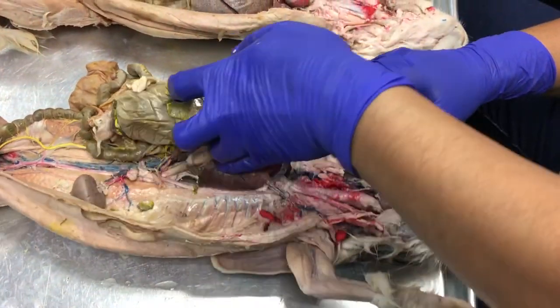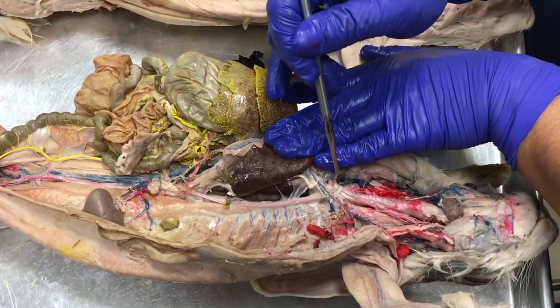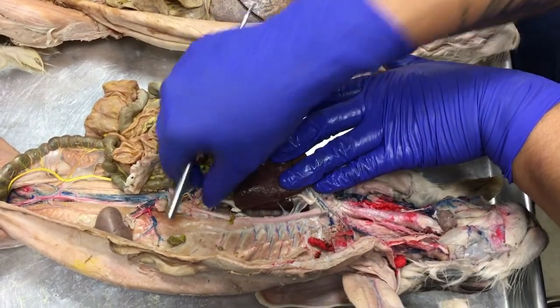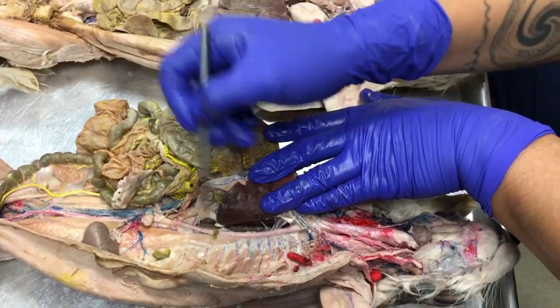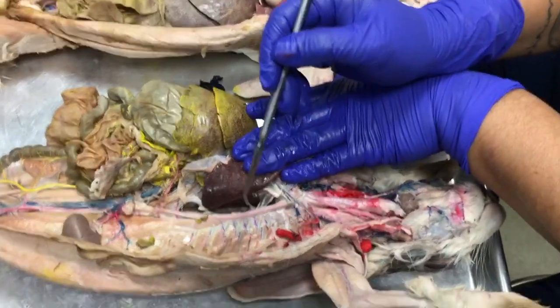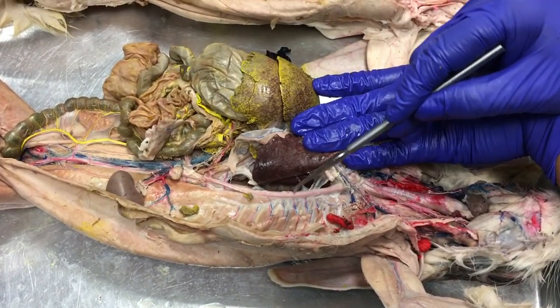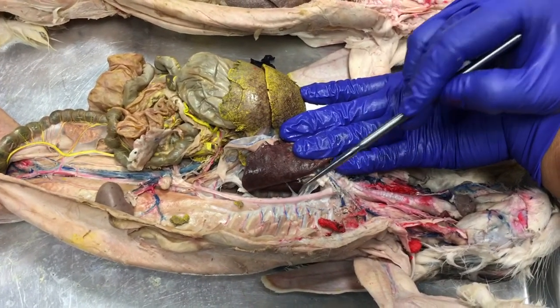So let's peel the heart over to one side, and we can see that the arch of the aorta makes a turn posterior along the vertebral column. Okay, so here's my diaphragm right here. So it looks like the diaphragm's right about here, cutting the body into thoracic and abdominal cavities. The aorta above the plane of the diaphragm is called the thoracic aorta. And all of these little pink tributaries that are going into the rib muscles here, those are the intercostal arteries.